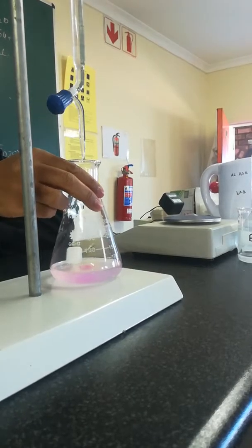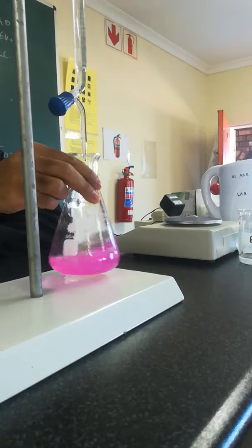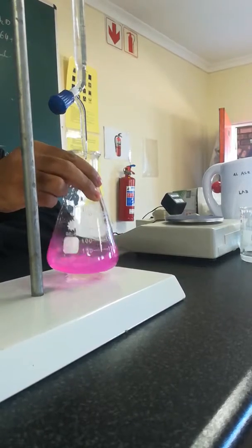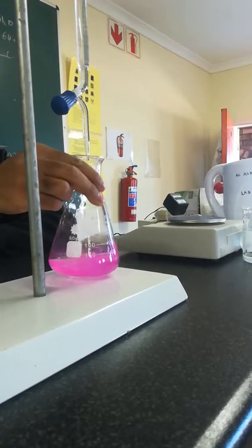One drop. There. You saw the difference. So we were definitely at end point. We were lucky. We got it nicely.